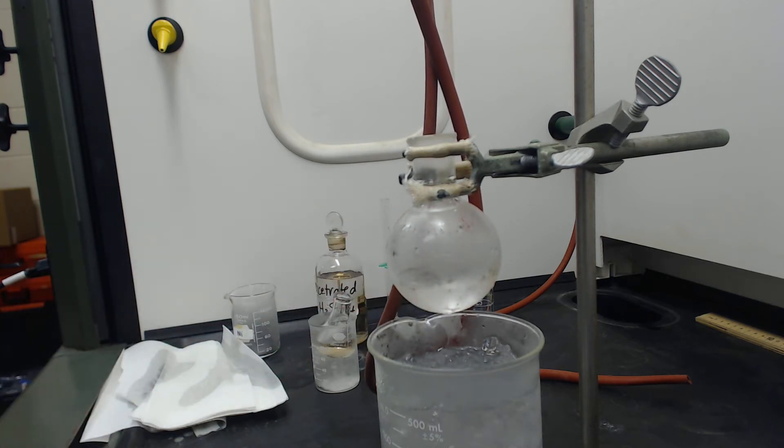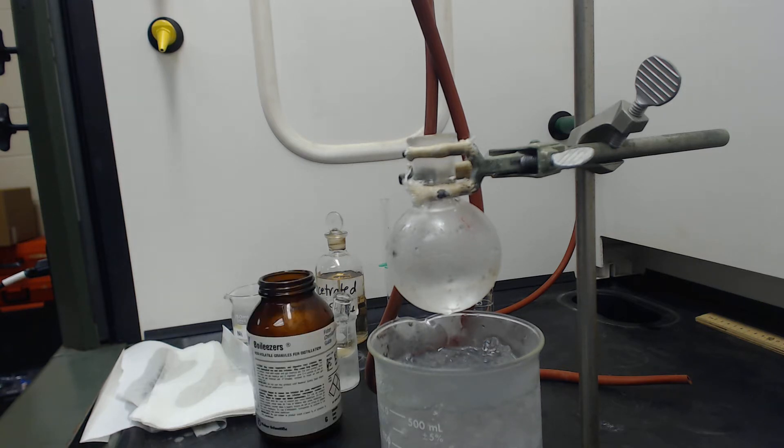Oh, I forgot to add the boiling chip. All right, so here are the boiling chips. I'm going to add maybe two to it, just to be sure.